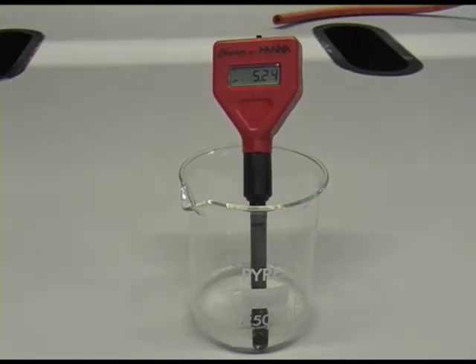Here we have a beaker containing shampoo and you can see that this is a weakly acidic solution with a pH of about 5.